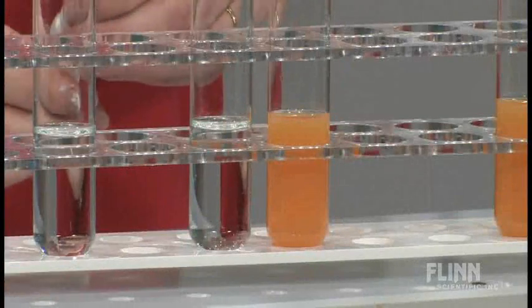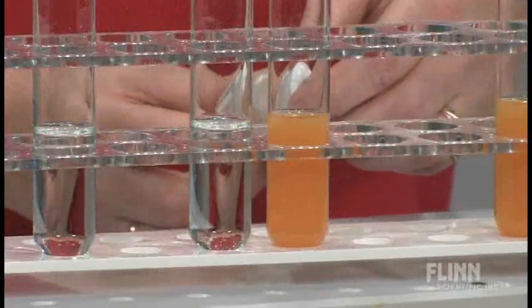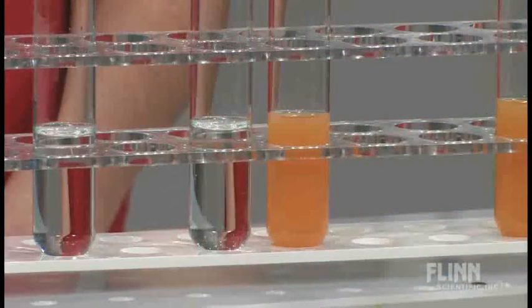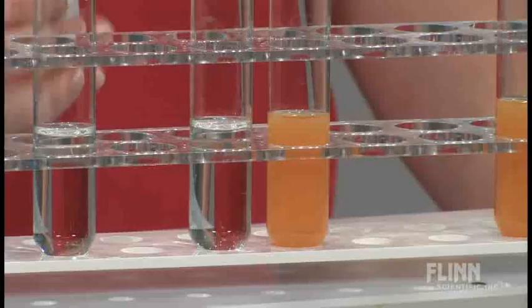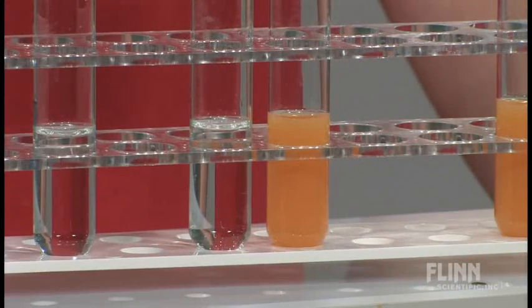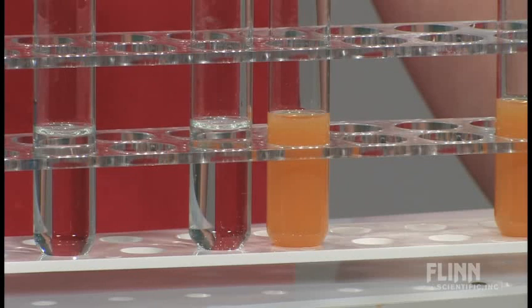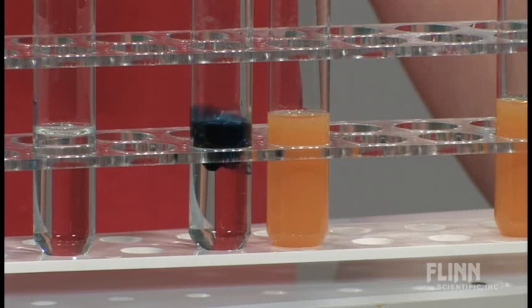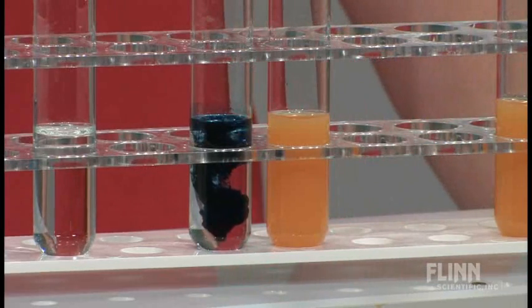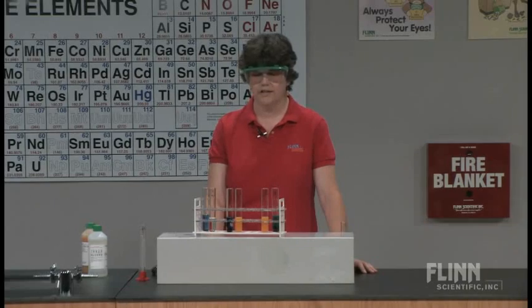And potassium ferricyanide is the three plus ion. It's a little bit yellow. I'm going to add my iron three plus oxidation state to my iron two plus oxidation state. And once again I get that beautiful blue color. So now I know there that I have both oxidation states of iron present.